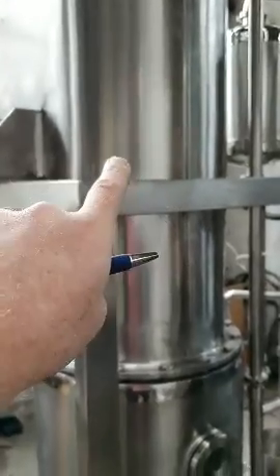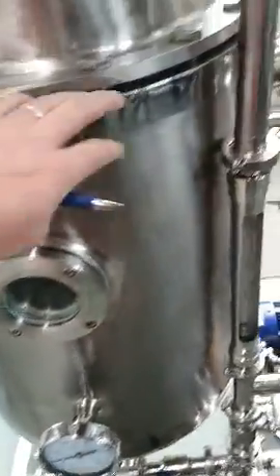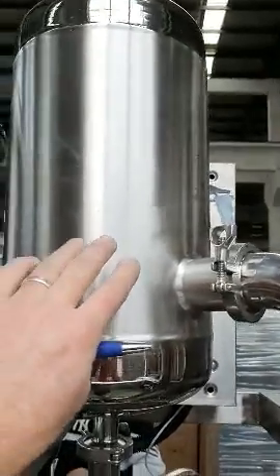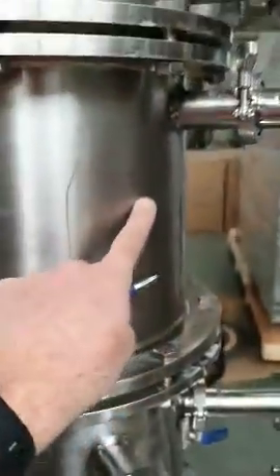This is heated by hot oil, which is heated electrically. The ethanol and oil fall down into this receptacle, but the ethanol is evaporated off into this column here, which goes into the top column. Any moisture left in the ethanol is then evaporated off down here, back into your crude oil — only a small amount. At the top you've got your condensing coil attached there.